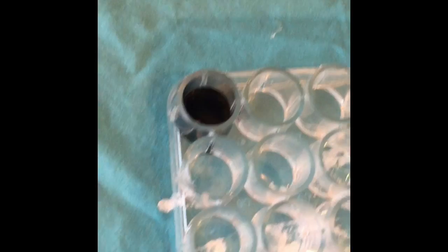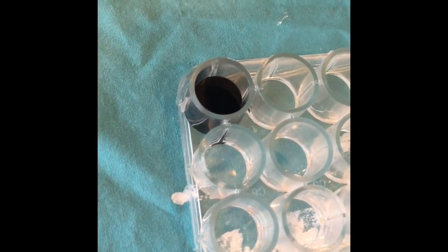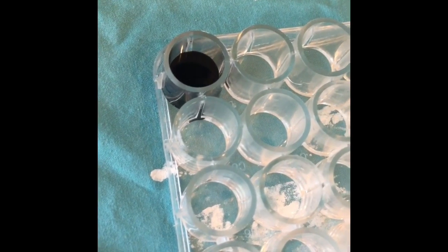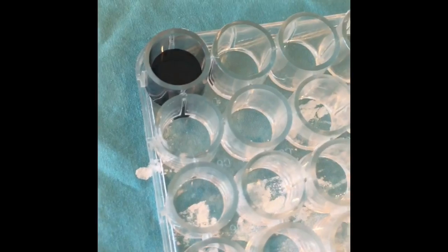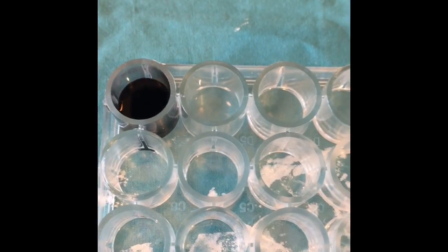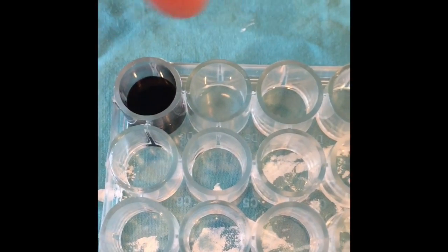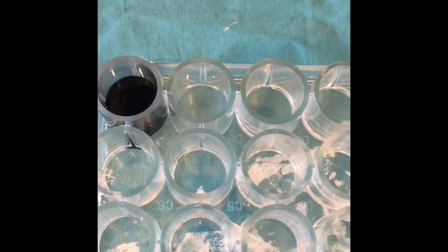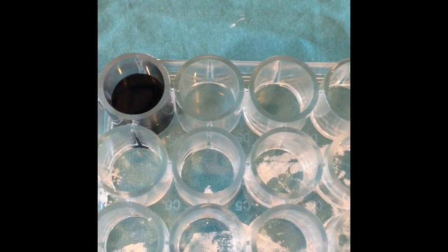The first reaction took approximately 35 seconds to turn dark blue, so I will be decreasing the number of drops of sodium thiosulfate. I am now repeating steps 1 through 10 of the calibration tests. I have only added 7 drops of 0.01 molar sodium thiosulfate to this second well right here, and I am now going to add the 0.4 milliliters of hydrogen peroxide.